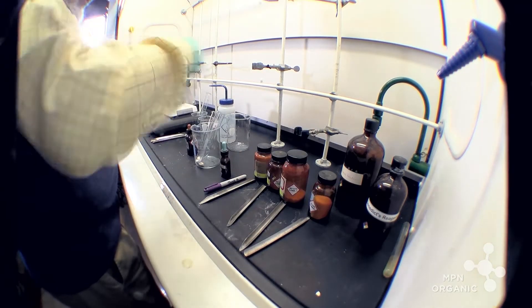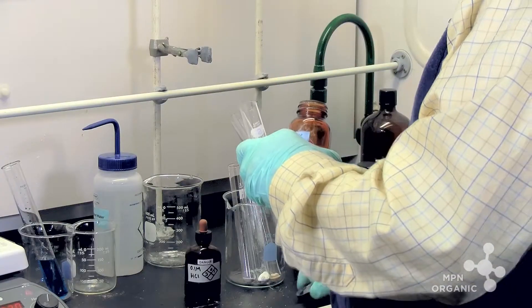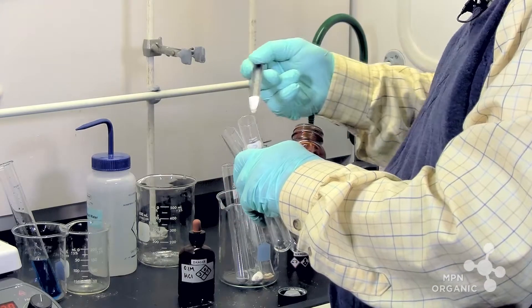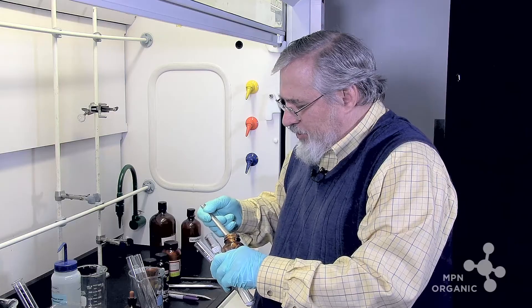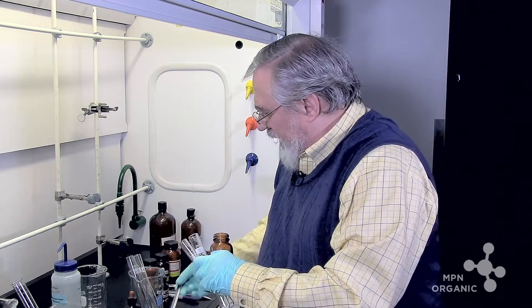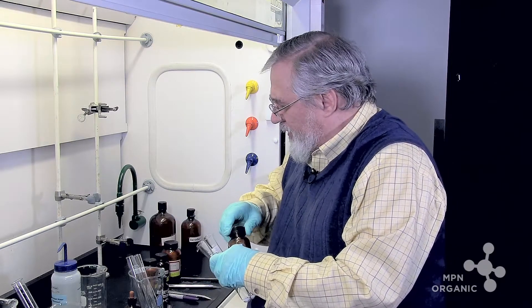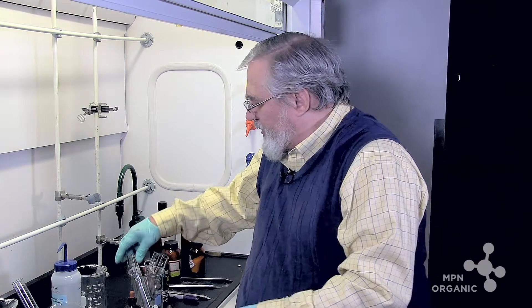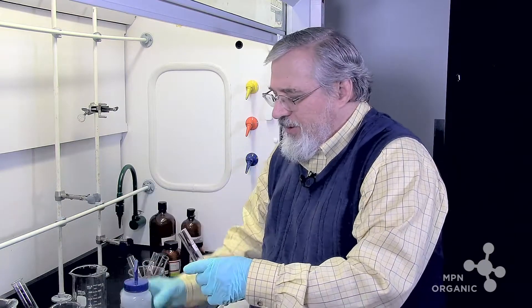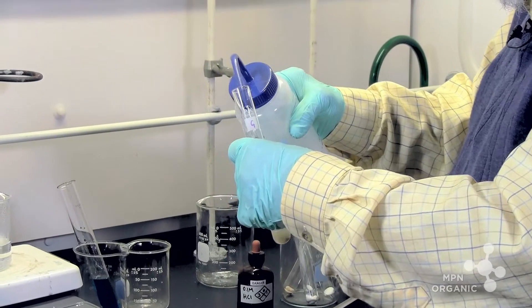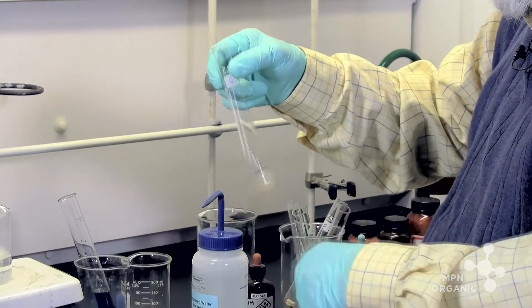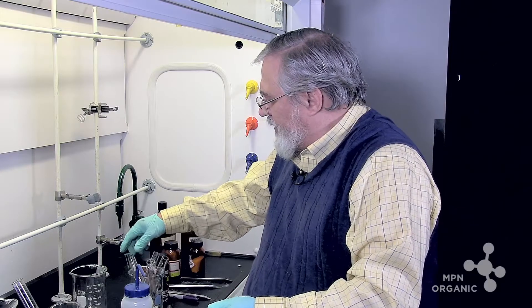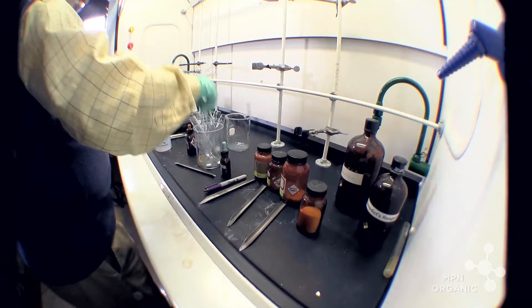And then I'm going to make two samples of sucrose. Now, sucrose is not like the others - sounds like Sesame Street - sucrose does not react like the others as we will see. But in any event, here we go. So we've got these five here and I'm going to make solutions of them in deionized water.